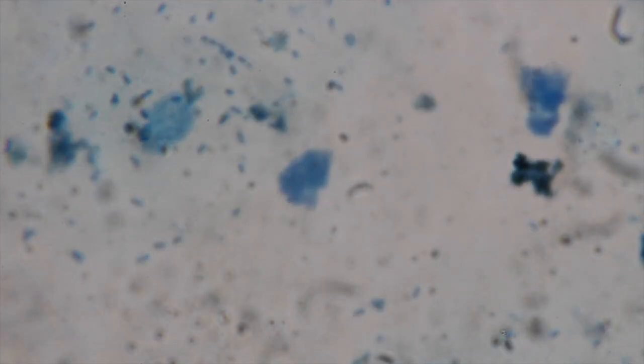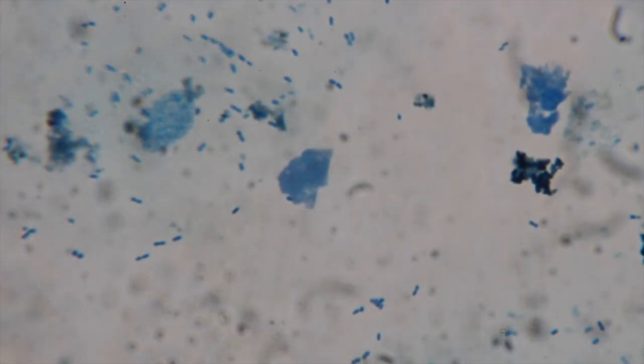So bacteria have a variety of different shapes. You can see a lot of different shapes in here. Most of them look like very small rod shapes. A lot of them are in pairs. So you can see how they're in pairs of 2. We have a chain in the upper middle, kind of a string of 1, 2, 3, 4, 5, 6, 7 of them there. We have a couple ones that are a little rounder, which are called cocci, rather than rods. Most of these are small rods, but there are a few that are a little bit coccus shaped. So a variety of different ones.